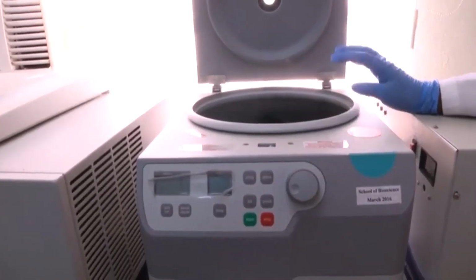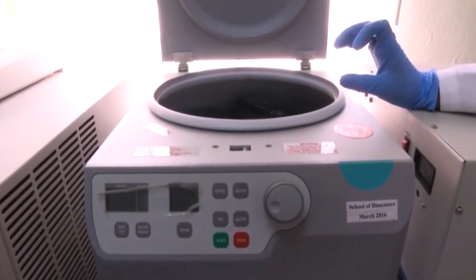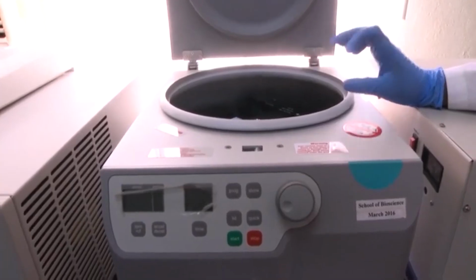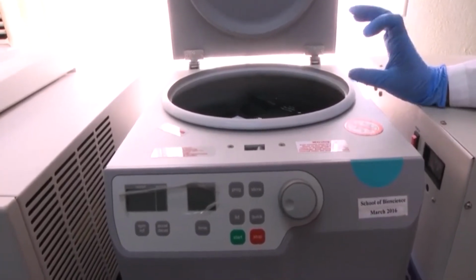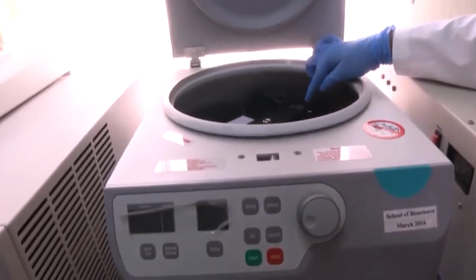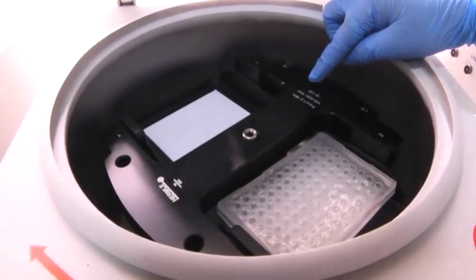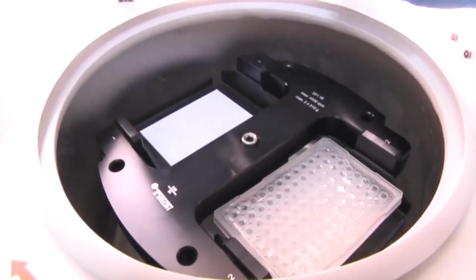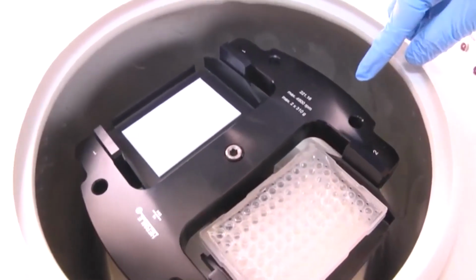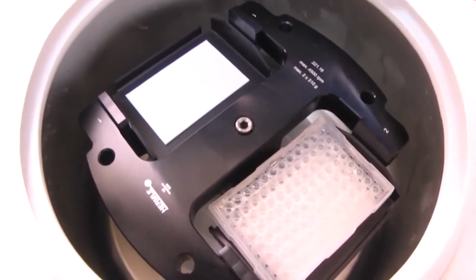This centrifuge here has a different type of rotor. So, till now what you have seen is centrifuge rotors which can accommodate centrifuge tubes, 1.5 ml centrifuge tubes. There are rotors which can accommodate 15 ml falcon tubes or 50 ml conical falcon tubes, but this rotor that I will be showing you here is a bit different, because this can actually accommodate 96 well plates. For many type of experimental purposes, you might need to centrifuge samples kept inside 96 well plates, and for that purpose this sort of centrifuge rotor is necessary.